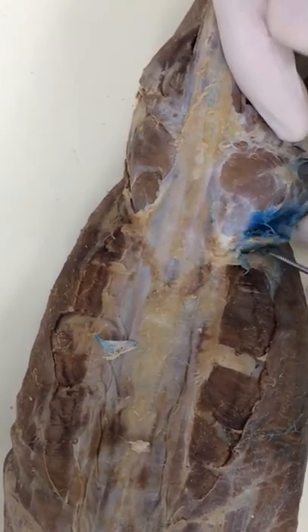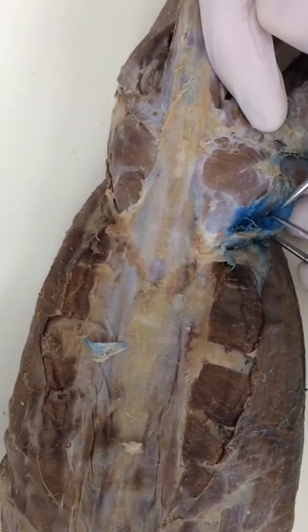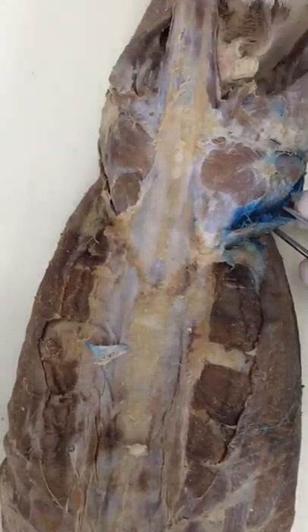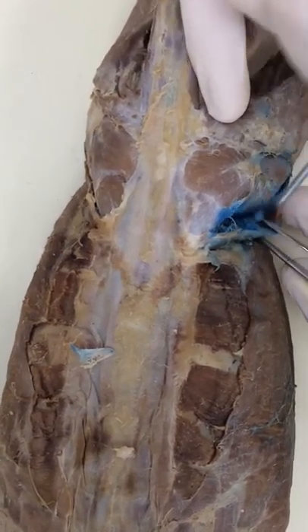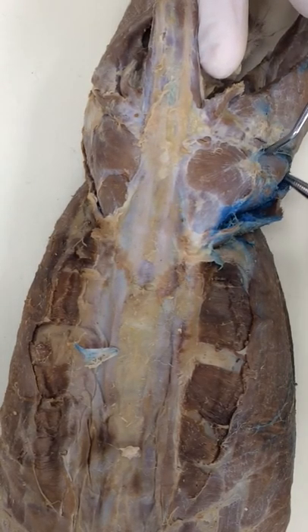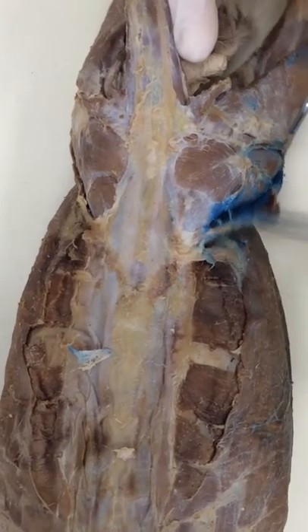Sartorius is a real thin strap. We're just going to do a piece of it right here, and there is a little latex on this one — it's kind of getting in the way. I'm just going to plow through that latex with the sharp end of my probe, switch to the round side, and just follow the curvature of tensor fascia. The vastus lateralis is underneath it. There should be a big white tendon right here, but it's already been removed. That's okay, but if you still see it there, that's why it'll look a little bit different. There's sartorius. Done.